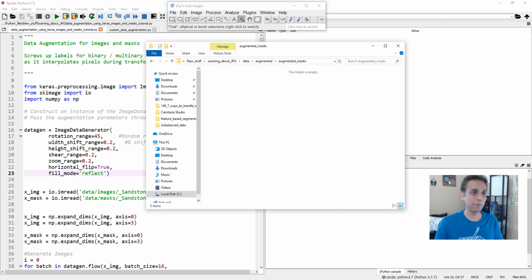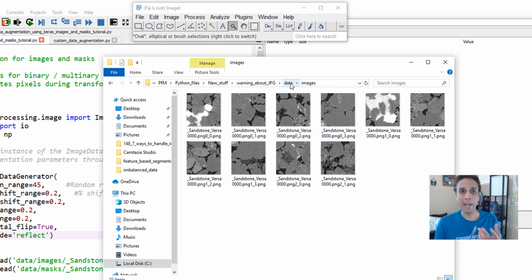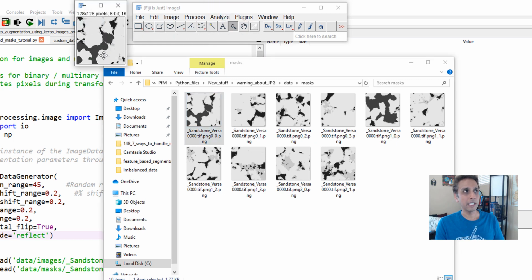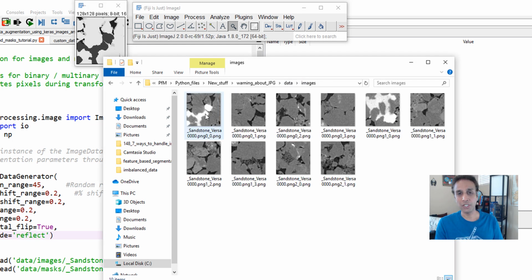Again, taking the example from last time. So we have images and corresponding masks. This mask here is a hand-painted label representing different regions in our original image. So this is a semantic segmentation example. This dark grayish region is representing these bright pixels.